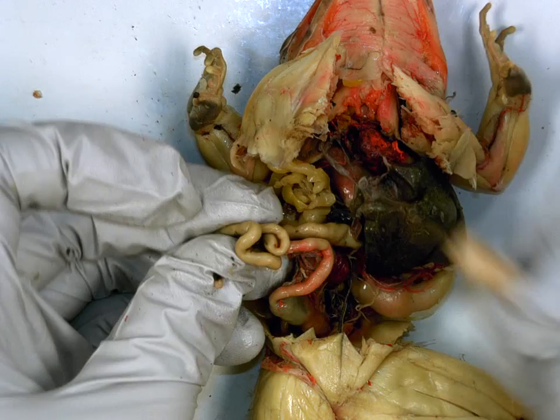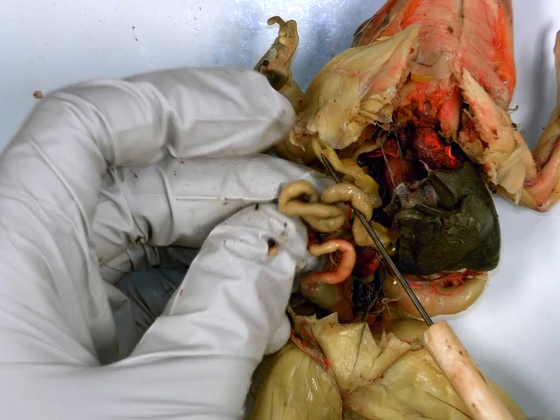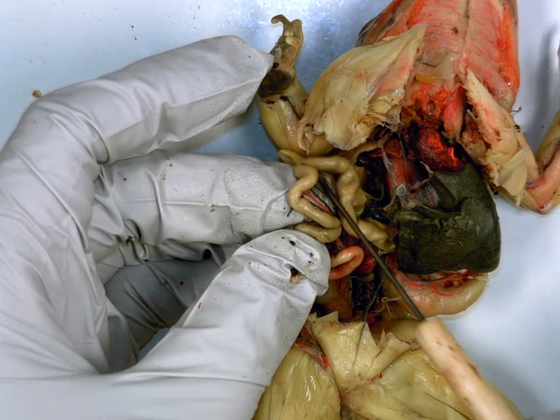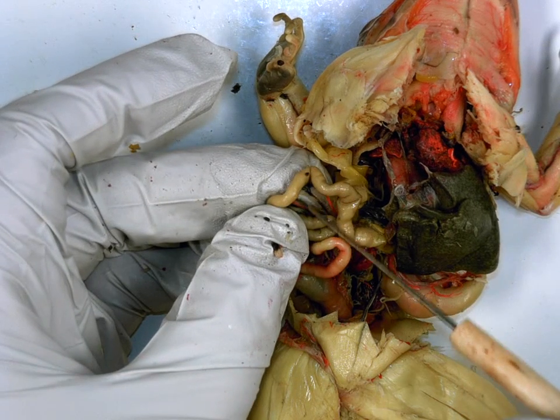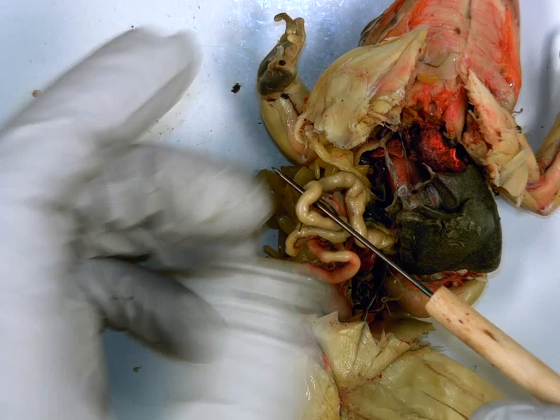Okay? All right, if we go further, what do I call this thin coiled up tube here? Small intestine is duodenum, which just means top portion. Function of your intestine. Absorbs nutrients and further digestion.